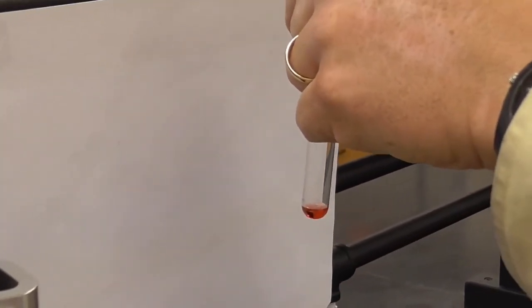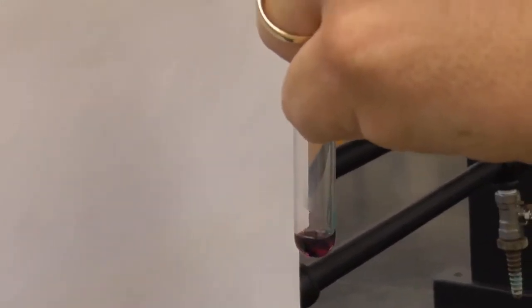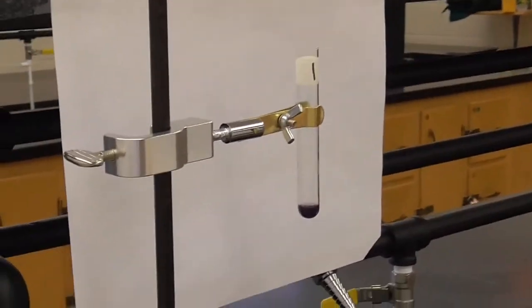And so there's 1 drop, 2 drops, 3 drops, 4 drops. You can start seeing a color change there. 5 drops, 6 drops. That is the more purple type color. I'll do 1 more drop. 7 drops, just so you can see that well. Okay. So that I'm going to go ahead and put here so we have that as a reference for what that looks like. So we've seen now both the left and the right side of that equilibrium.